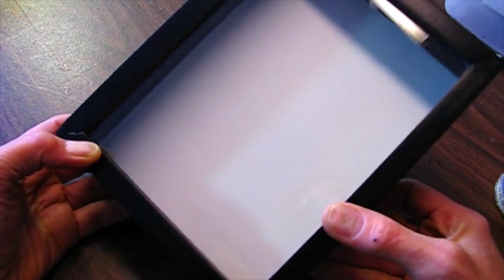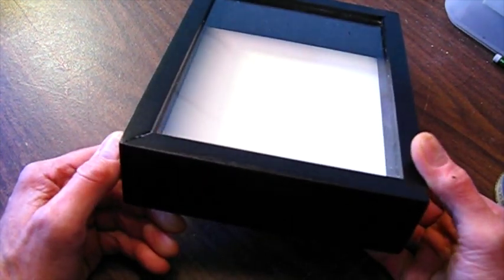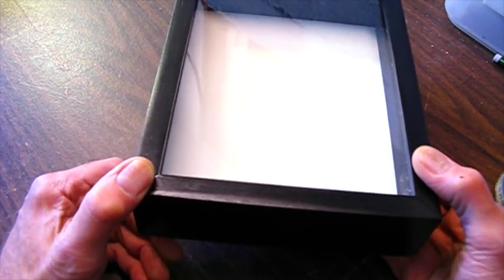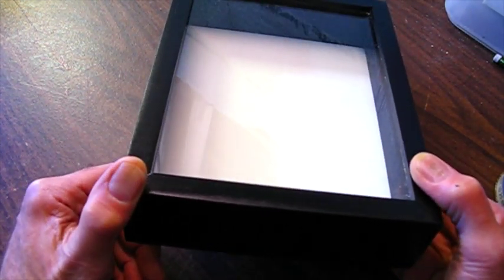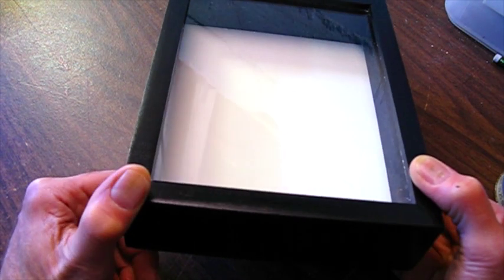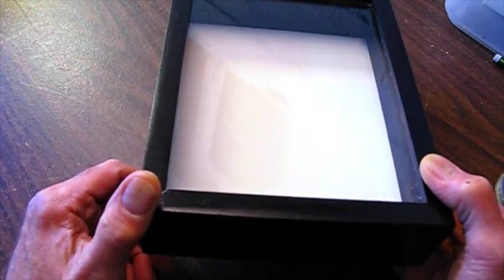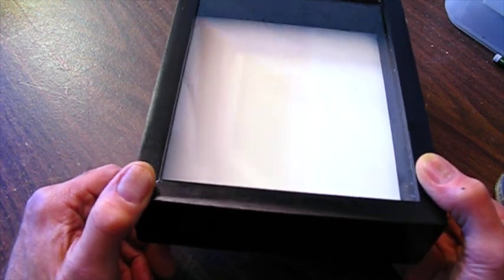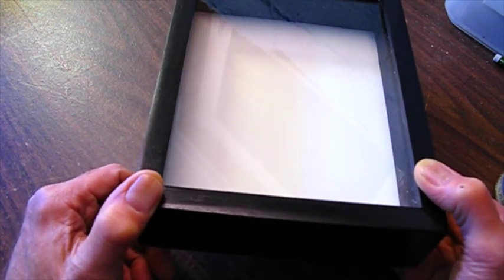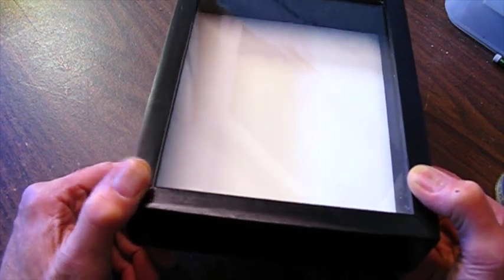Today I'm going to show you how to mount insects in a frame to hang on a wall. Most of the specimens I prepare I put in pinned specimens in drawers for a teaching collection, but sometimes people would like to have a butterfly or insects in a frame and hang it on the wall. So I'm going to show you how to do that.